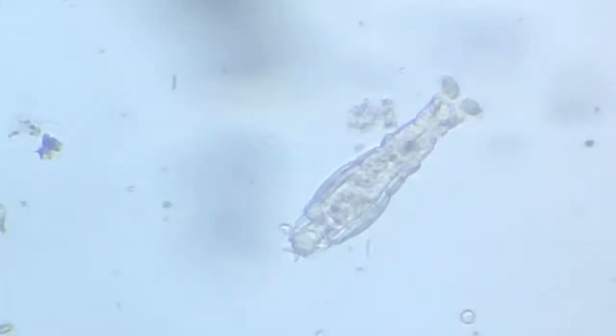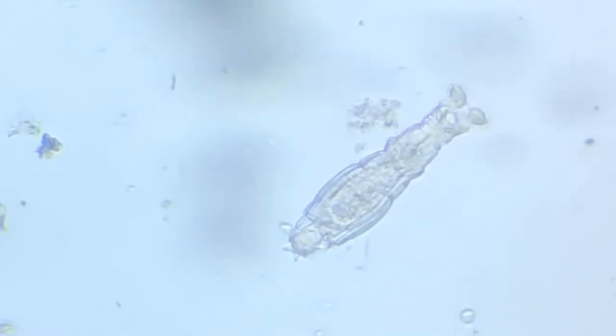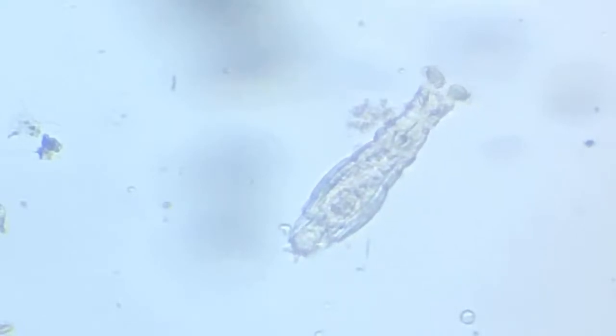Okay, so I think we've had enough of this fellow now. And we shall now proceed to some other part of this slide. There is something more here. Another creature here. Now, what is this? You may wonder. There you see something right in the center of the frame. That is something, again, it's something live.